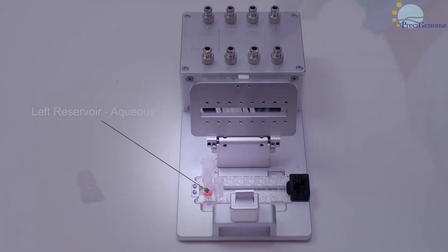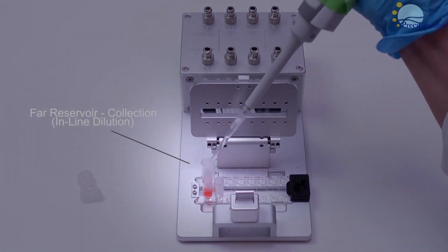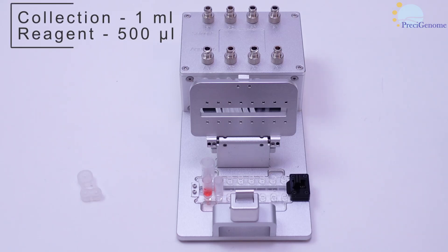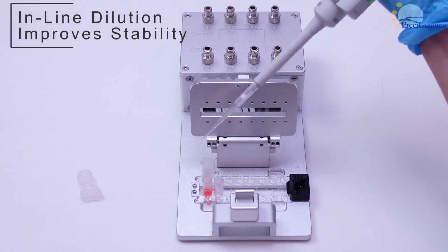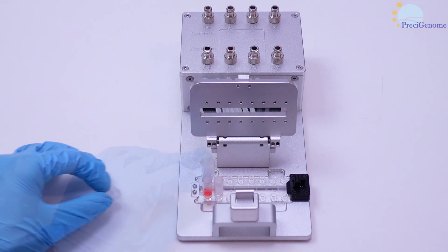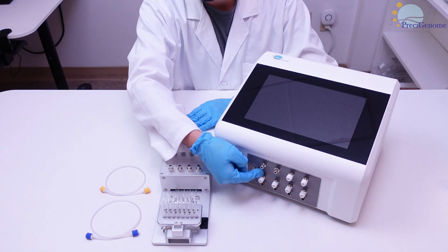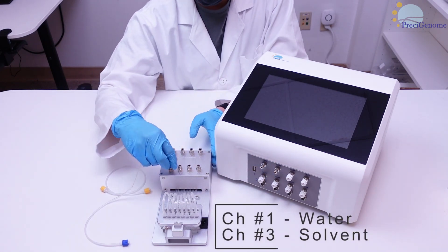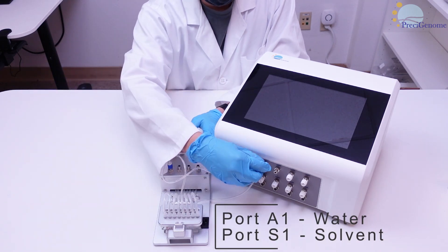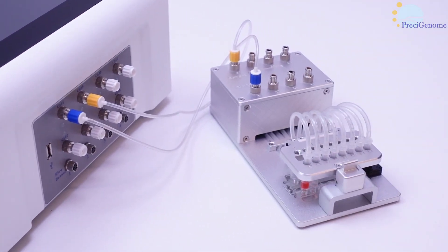You may optionally add 15% extra to the theoretical consumed volume of each inlet. The far reservoir is for collecting solution, so it also has a larger capacity of 1 milliliter versus 500 microliters. We recommend loading it with aqueous buffer as an inline dilution — this can improve nanoparticle stability. Cap the reservoirs with the gasket and lock the FLEX-S to ensure a proper seal. We will next connect it to channels 1 and 3 on the iFlow Touch. Channel 1 will supply the aqueous pressure and channel 3 the solvent. The corresponding ports on the FLEX-S are labeled A and S with a number matching the chip channel. Here we used chip channel 1, so we need to use ports A1 and S1.